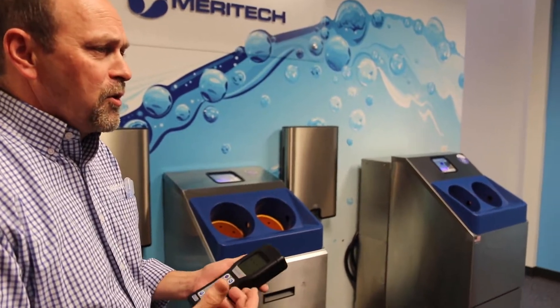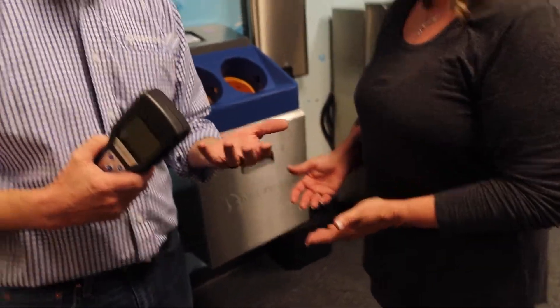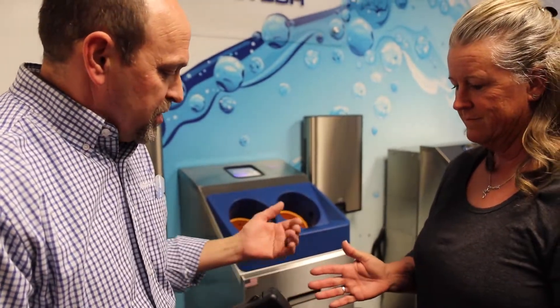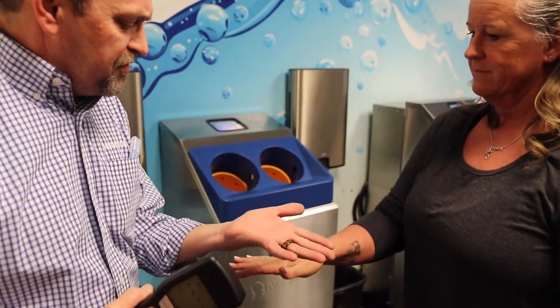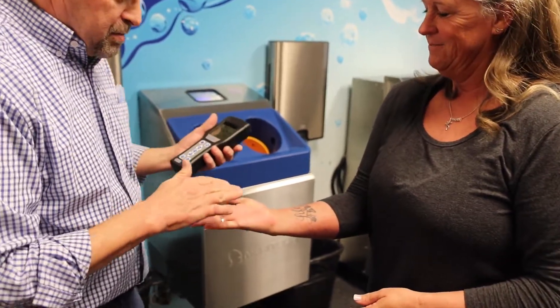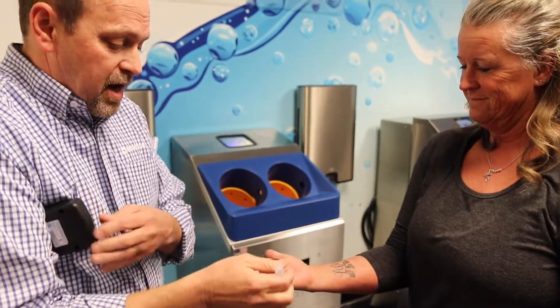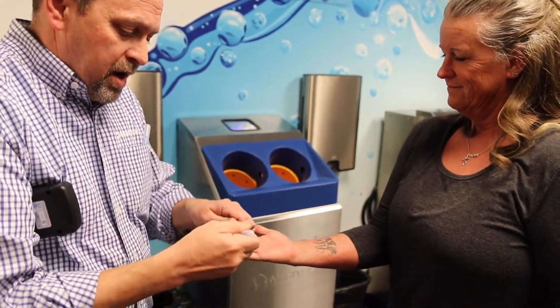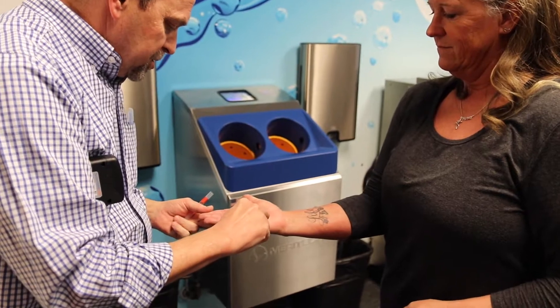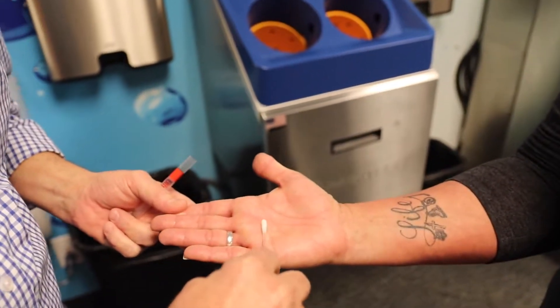So Lisa, why don't you come on over? One of the first things I do is ask her what her dominant hand is. Go ahead and present that to me — palm up, kind of go really flat. What I want to do is make sure that palm is sitting there. I'm going to take a Hygiena swab, pull it out, and draw a two-by-two square directly in her palm.